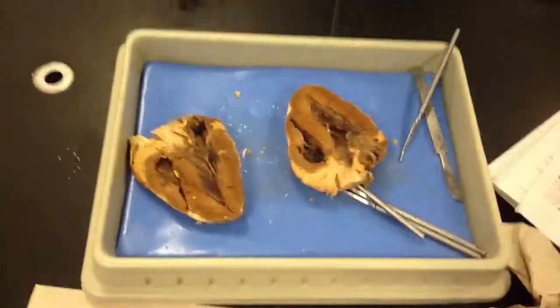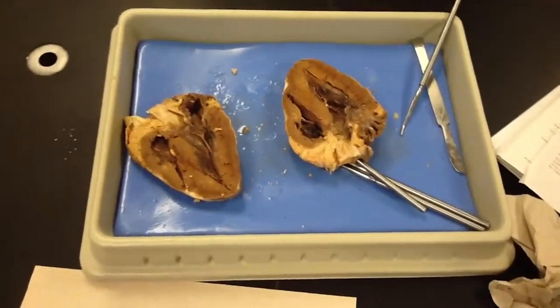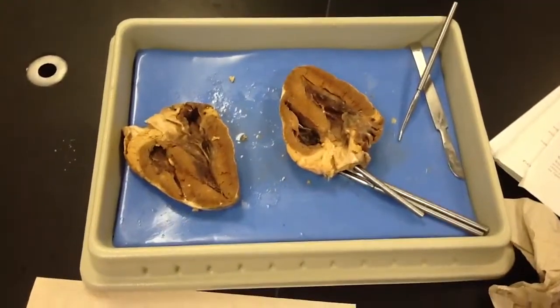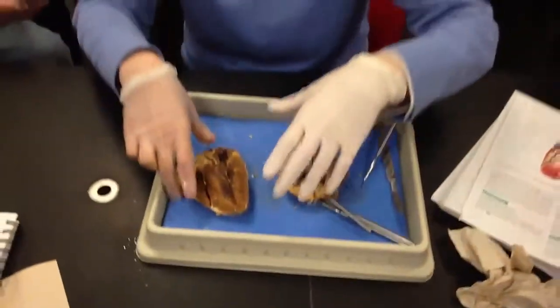Do you guys want to come over here and do it with us? Well, we actually want to see it on our own because ours is cut kind of funny. Ours is cut a lot better. Alright, if you guys want, we can just look at it together. It's up to you guys.